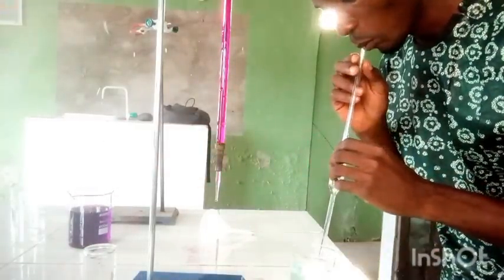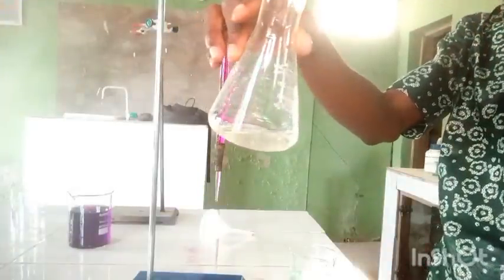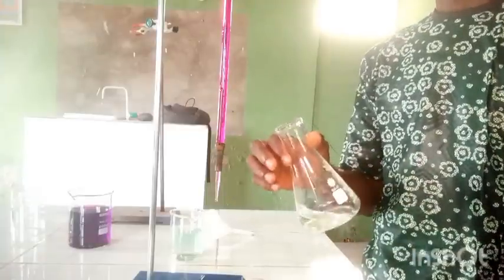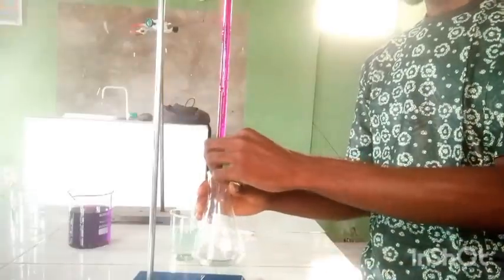I draw 25cm³ of solution B into the pipette and introduce it into the conical flask. We are going to titrate now and ensure we get a good result. Once the colour of this mixture changes to pink or red, we have reached the end point.